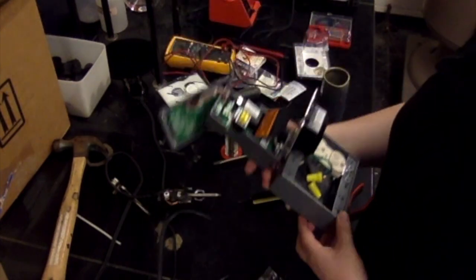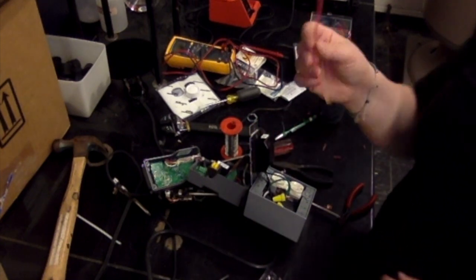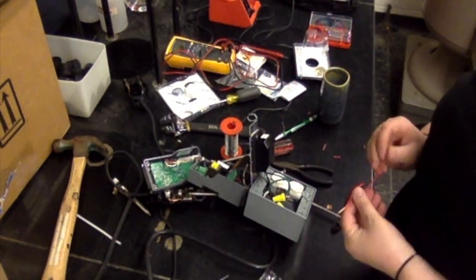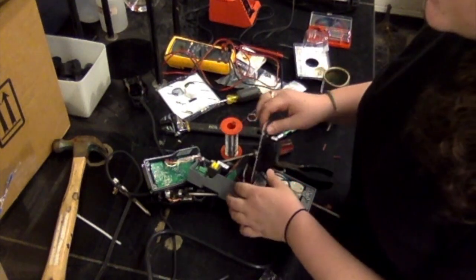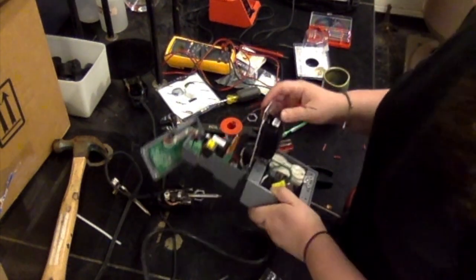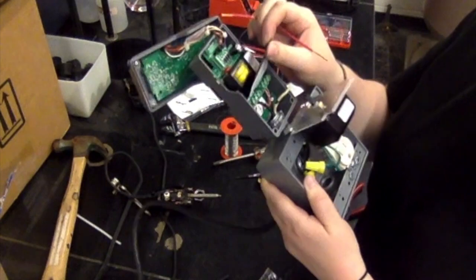And the next thing we're going to do is make the last couple connections. We're almost there. You're going to need a wire. I have a red one here. And what this wire is going to do is connect to the silver side on the two gang outlet with port number 2. The glitch is that we also have to get the white cord from the line cord to come up through A14 and also go into port 2.